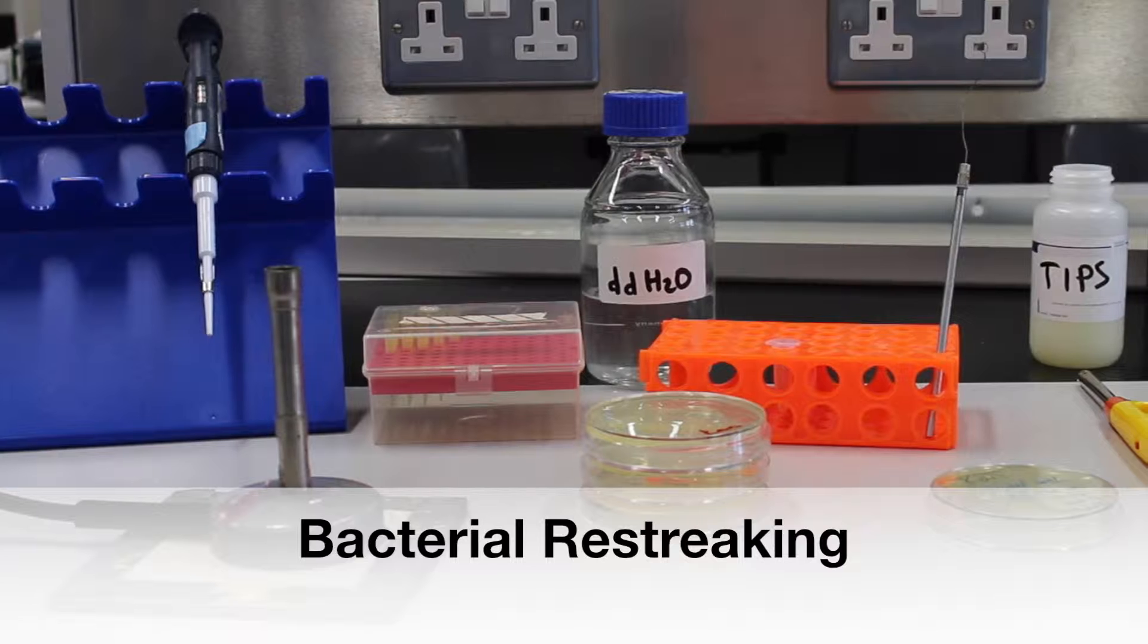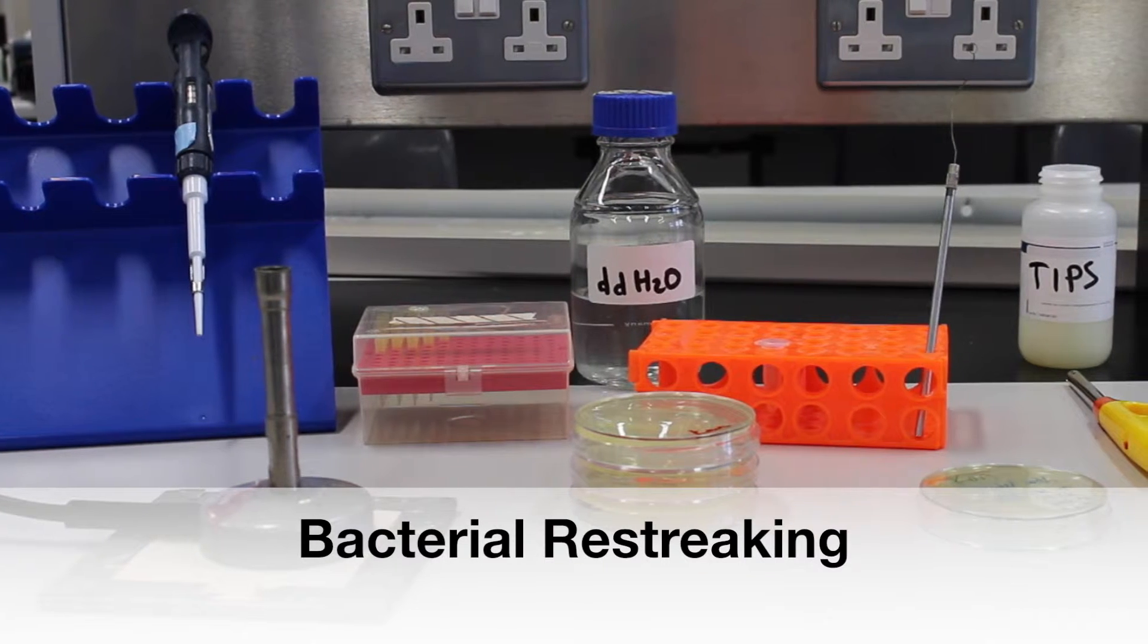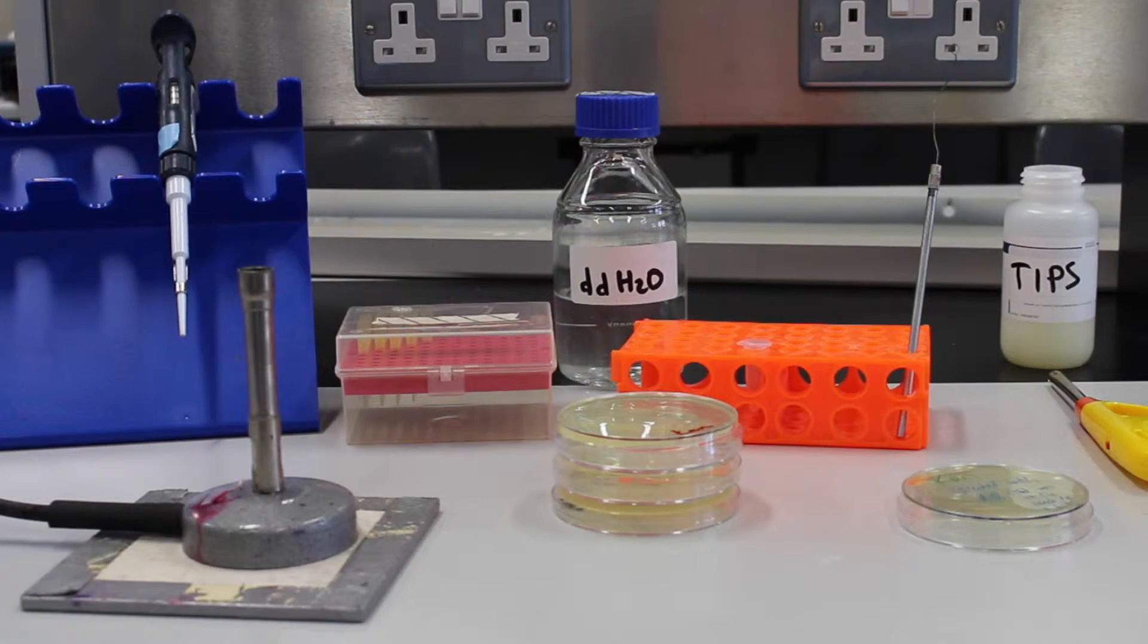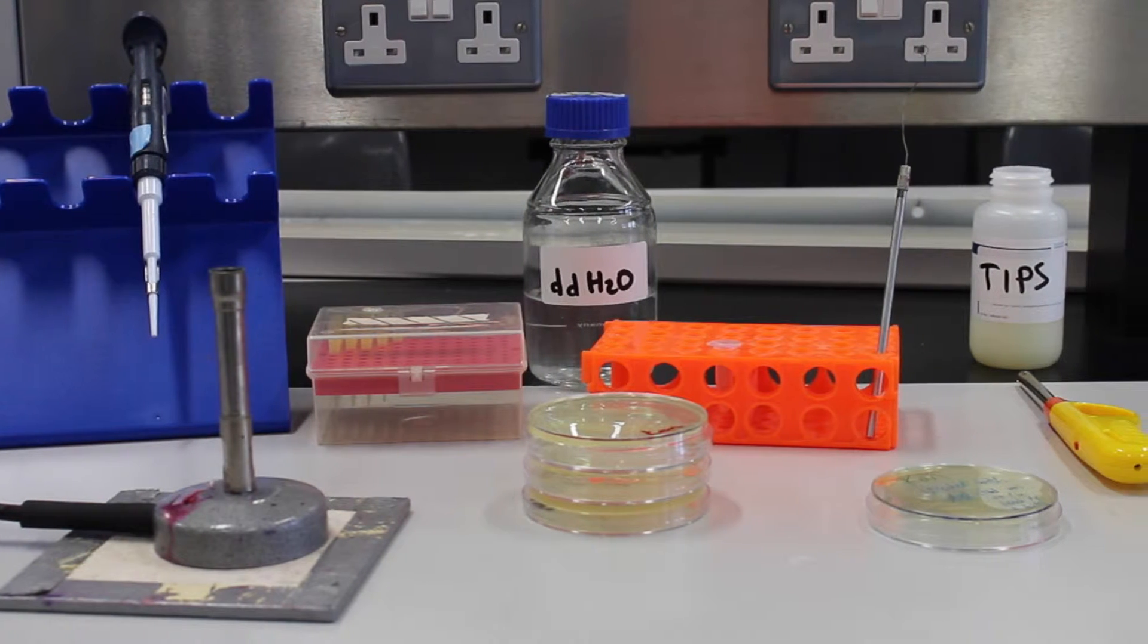This video is part of the iGEM Academy series, a beginner's guide. This tutorial shows how to carry out a bacterial re-streaking.